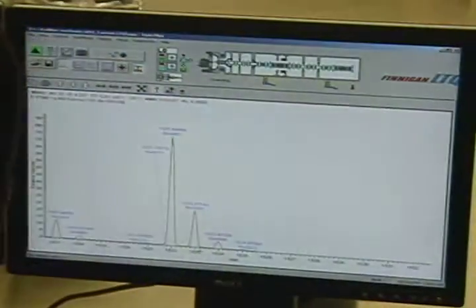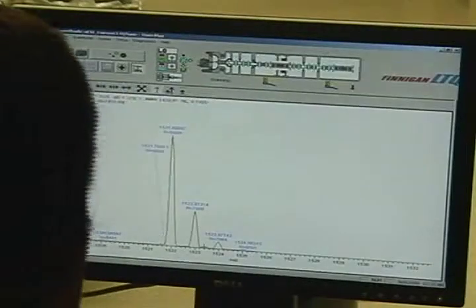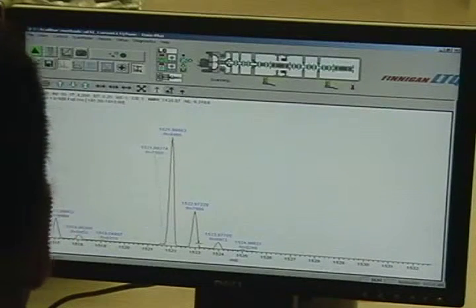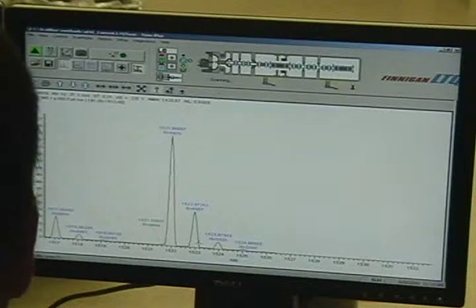And the RMS can, if some of them are high and some of them are low, it kind of averages out. So it's the root mean square across all the different peaks? Yeah, it averaged out the crap. They were all kind of low, and that were high, and then... Yeah, it was all over the place.